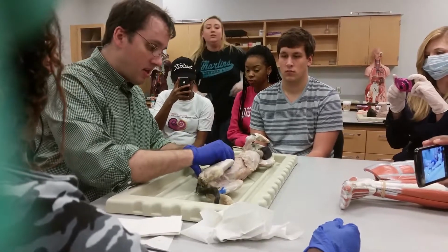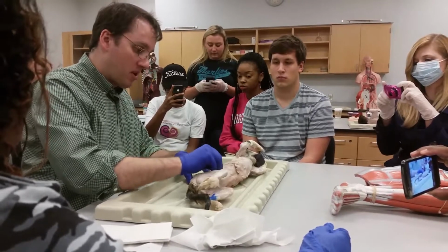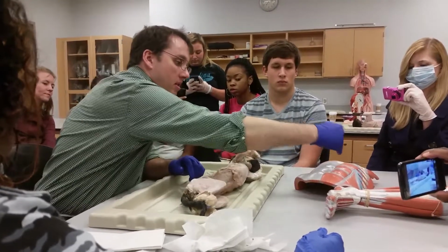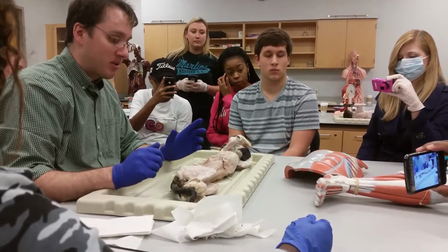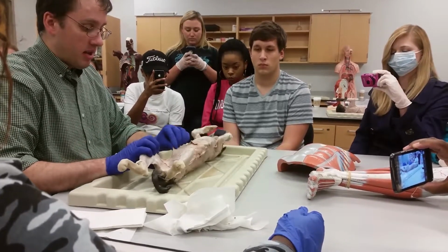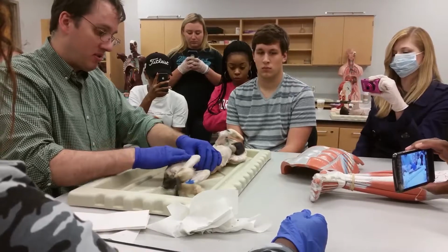muscles. They have parallel fibers in a parallel arrangement. As we can see on this model of the human torso, they're all parallel arrangement fibers. They're wide, thin, flat muscles, so they end in wide, thin, flat tendons, which remember we call aponeuroses. So the abdomen is covered with these thin muscles and the aponeuroses of the muscles.